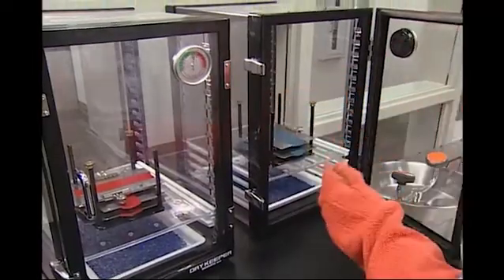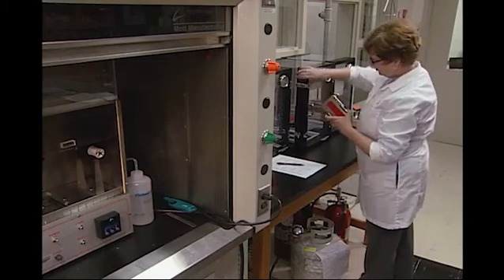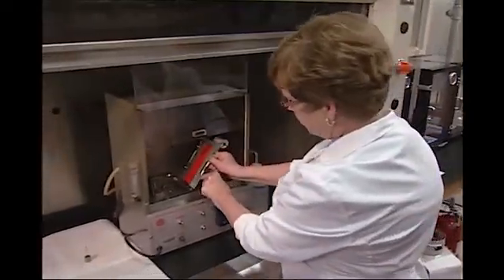The specimens are brushed from the open end of the specimen holder toward the closed end in order to raise the surface fibers to their highest level. Racks holding the framed, brushed specimens are put into a circulating air oven set at 105 degrees centigrade for 30 minutes. Once removed from the oven, the racks are moved into a desiccator where they're cooled but no humidity is added to the specimens. One specimen at a time is removed from the desiccator and immediately placed on the inclined plane assembly inside the test cabinet.